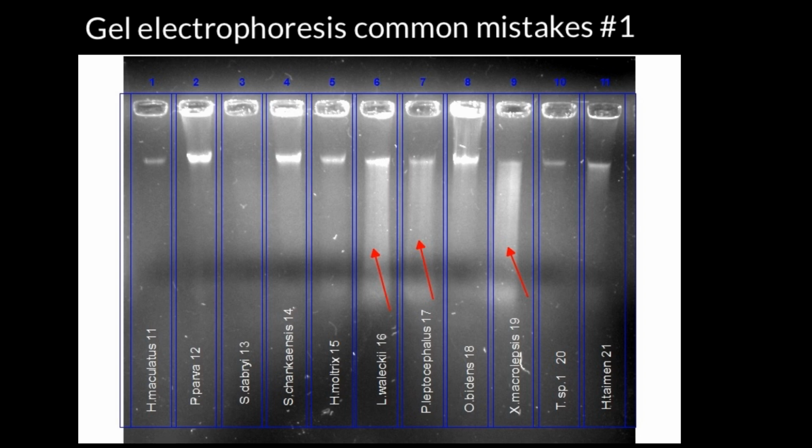And how do you know it? In order to know it, you also have to load a ladder in one well, a reference ladder of known sizes of DNA, and if you see a smear in your ladder as well, that probably means that your gel was made with a mistake, so you have to check your protocol.